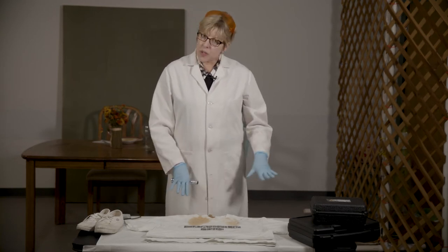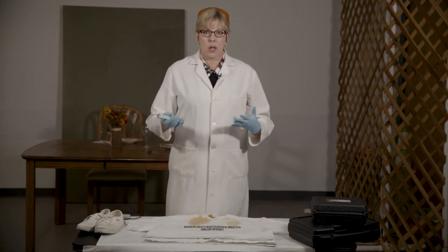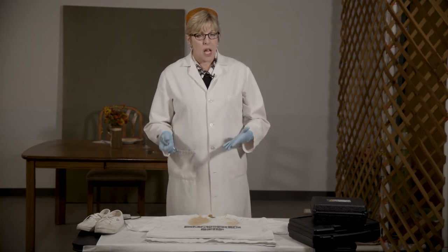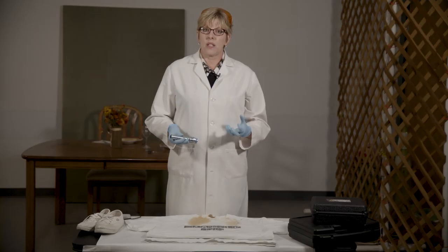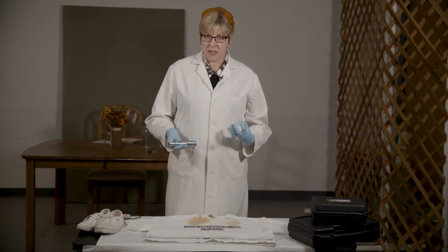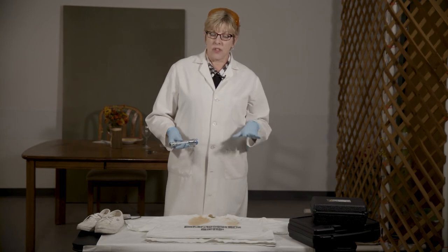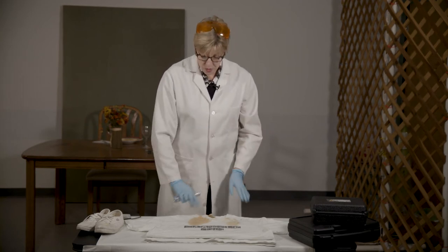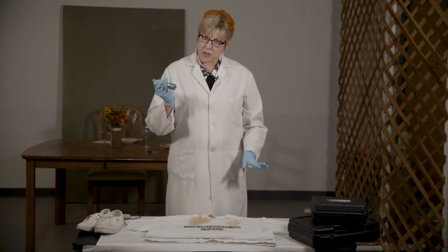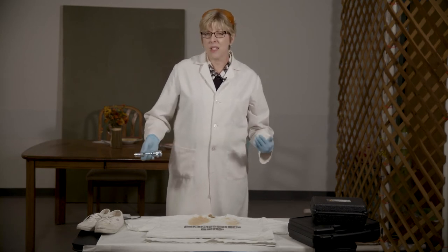As we talked about at the crime scene, TV shows that blood can also fluoresce — and as we saw at the crime scene, that's not necessarily the case. Blood actually absorbs or quenches that fluorescence, and blood will look darker against the substrate that it is on. So let's take a look at this t-shirt using the alternate light source to see if there are any stains we're possibly missing.